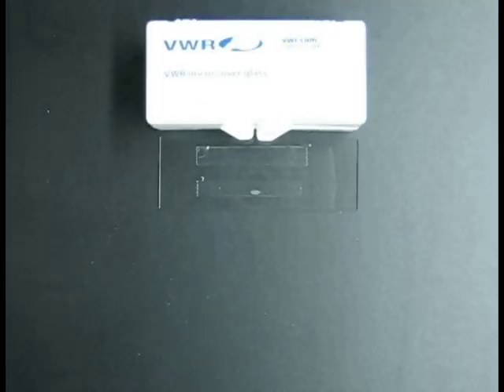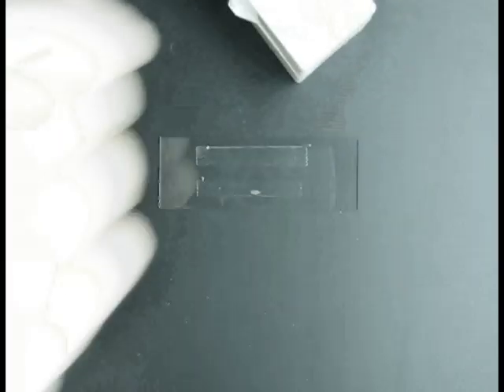After the excess tape is removed, a slip is dropped over the channel. A box cutter is then used to smash the slip onto the tape. You can use a decent amount of force on the slip as long as the pressure you apply is over the tape.